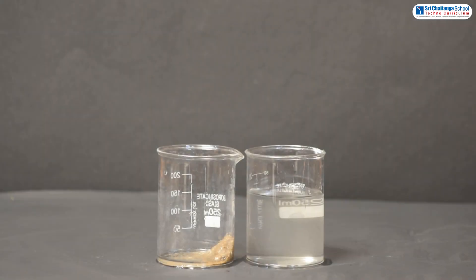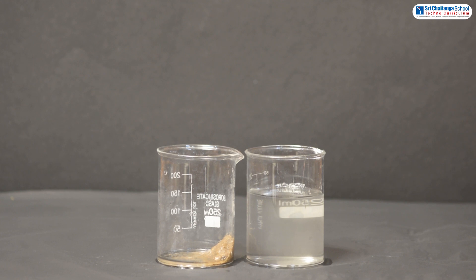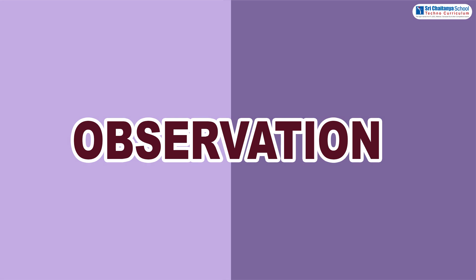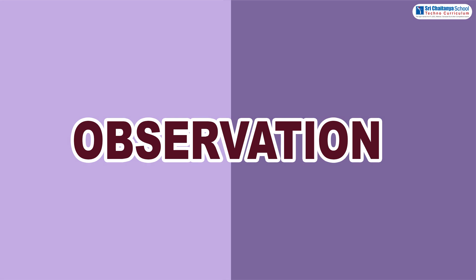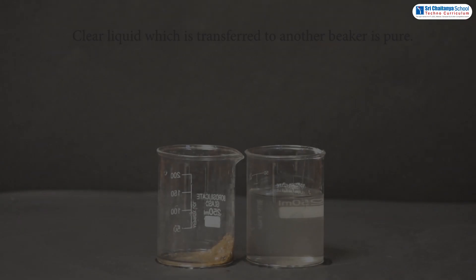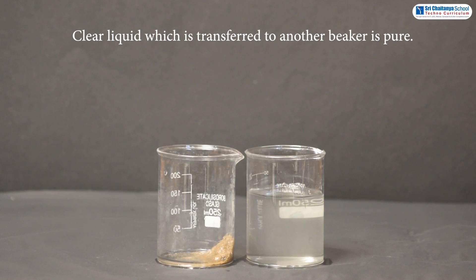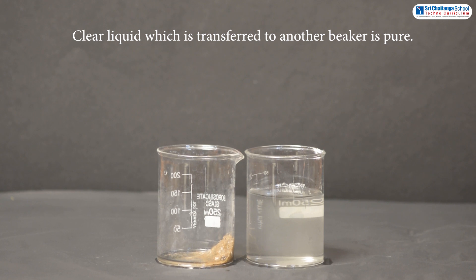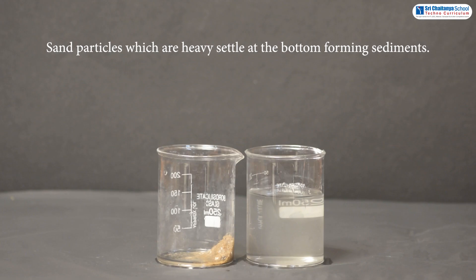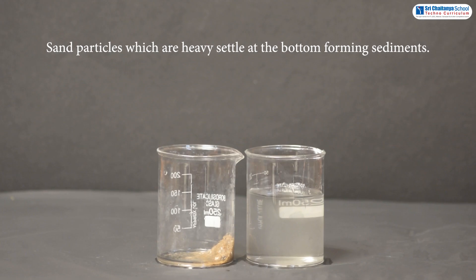Sand is left at the bottom. So what did you observe, my dear children? The observation is: the clear liquid which is transferred to another beaker is pure. Sand particles, which are heavy, settle at the bottom forming sediments.